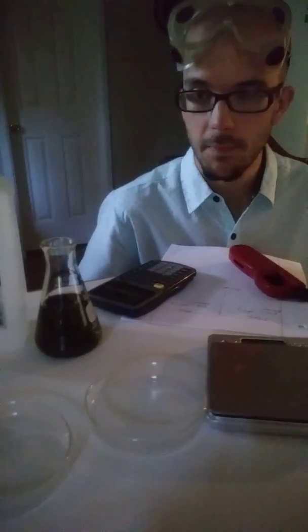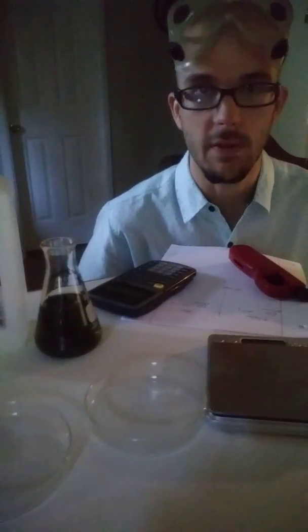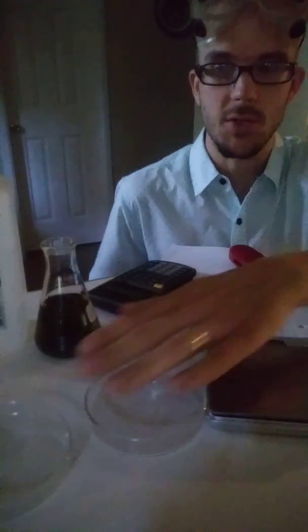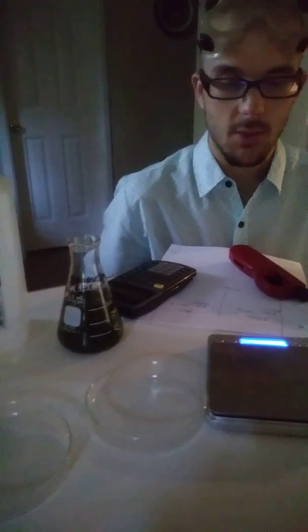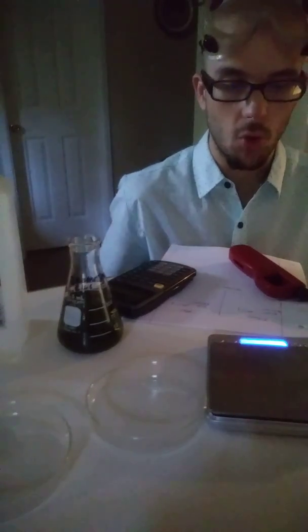If you think carefully, the setup of this experiment — or this demonstration rather — is exactly the same as the soda investigation. We have our two petri dishes, we're going to use bromothymol blue, which will indicate whether there's any change in pH, and we're also going to use our scale.